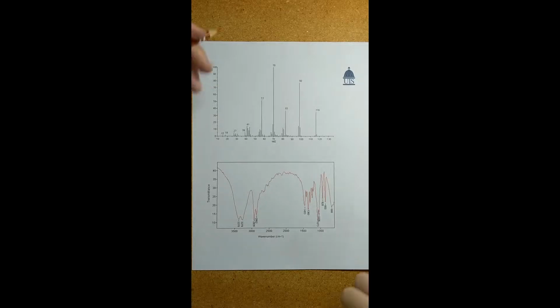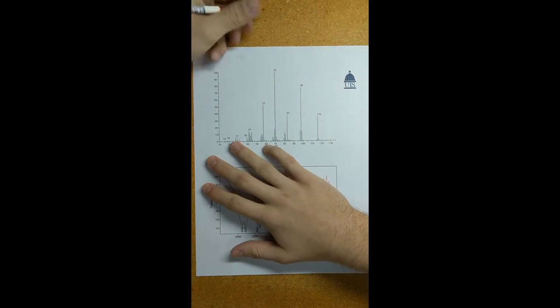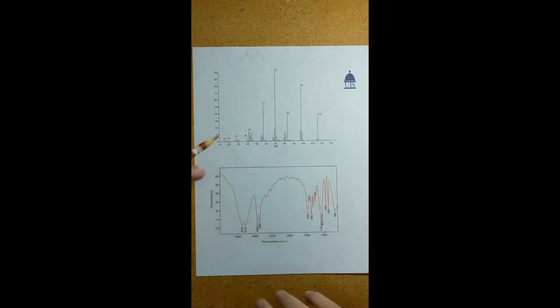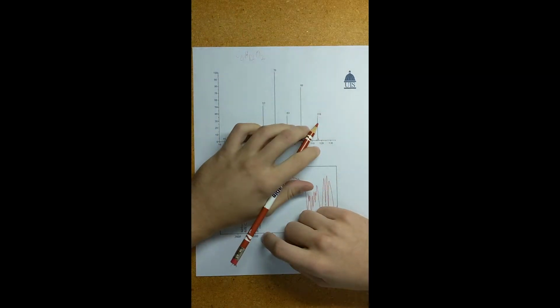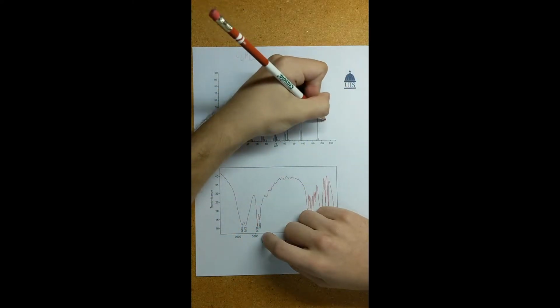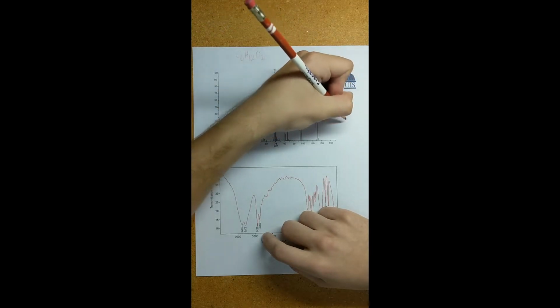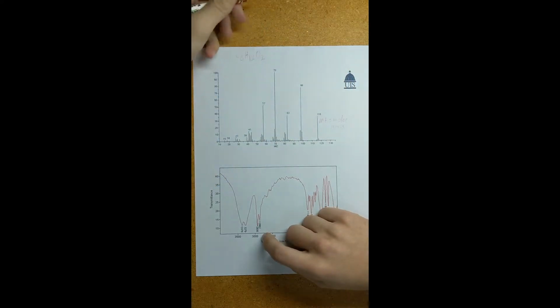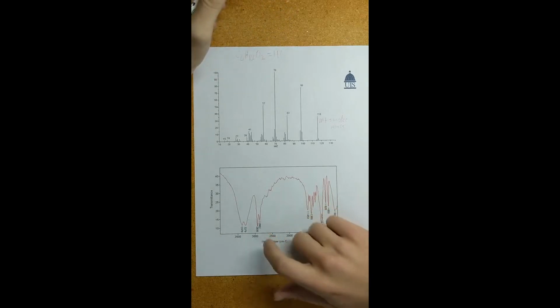Alright, so today we're first going to start with looking at mass spec. And first I'm going to label our structure. The structure today is going to be C6H12O2. So with mass spec, we're going to work right to left. The first thing that pops out here on the right is this final peak that says 116. This is actually going to be our M plus peak, which labels our molar mass. And if we do the math, we'll see that C6H12O2 does equal 116 for its molar mass, so that's perfect.